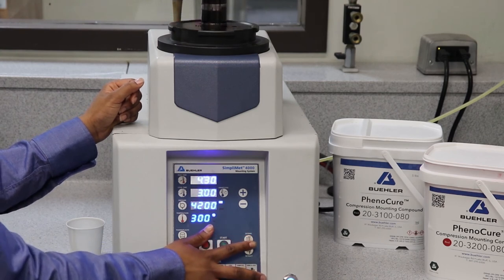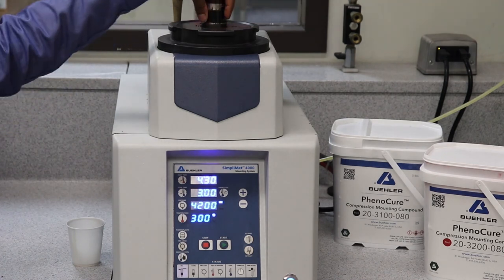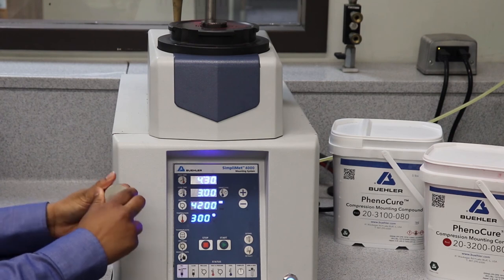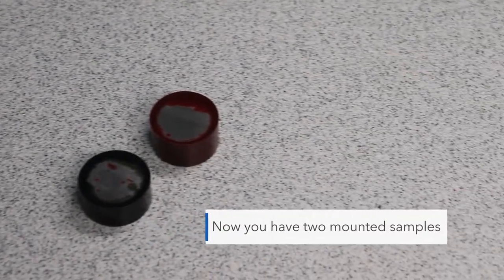So now that you're done, you can open the chamber and take your samples out. Now you have two samples mounted.